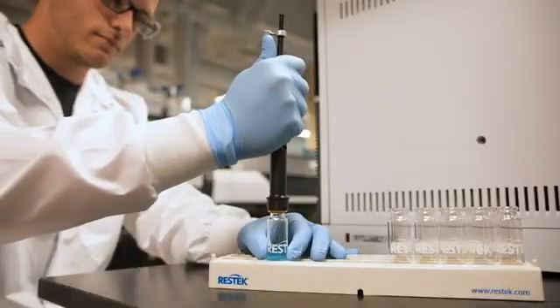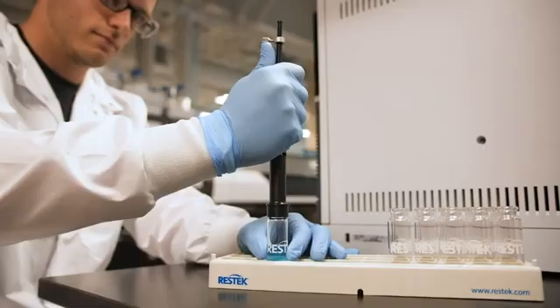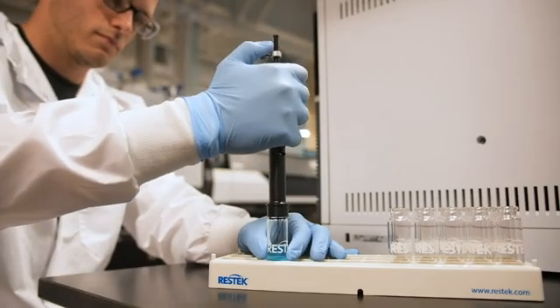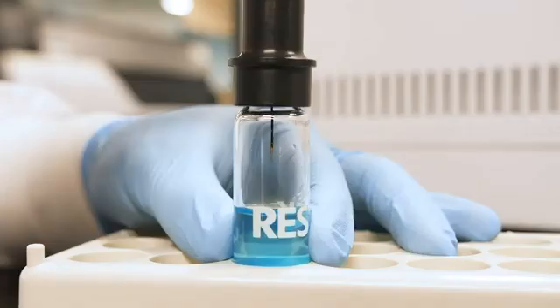As you pierce the vial, continue to apply upward pressure on the top part of the tool until the tool is completely inserted. Now it's time to expose the arrow's fiber. Carefully shift your grip on the tool so you can use your thumb or finger to press down on the top part of the tool. Continue to press down until the fiber is completely exposed.